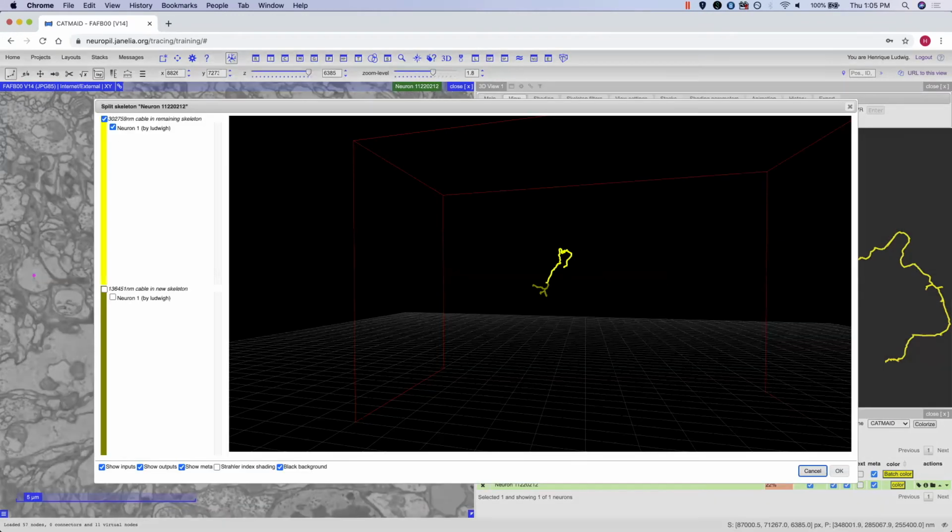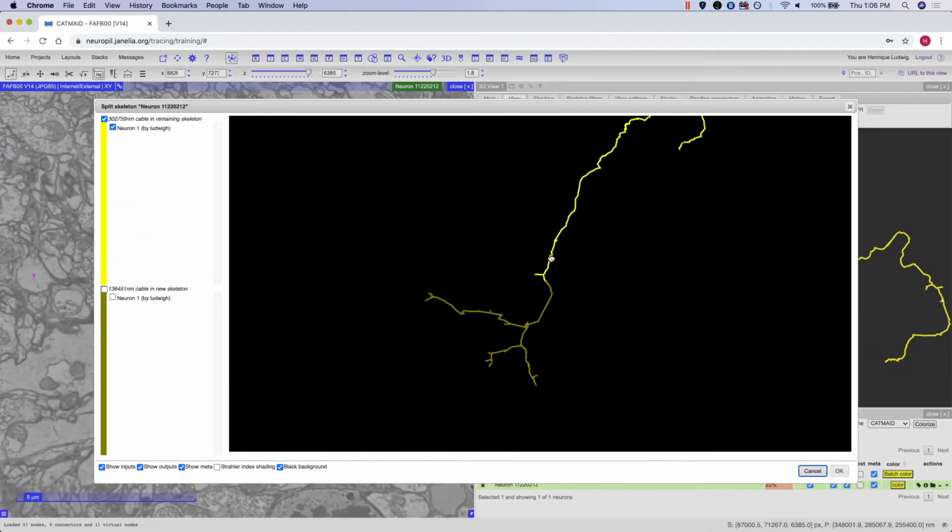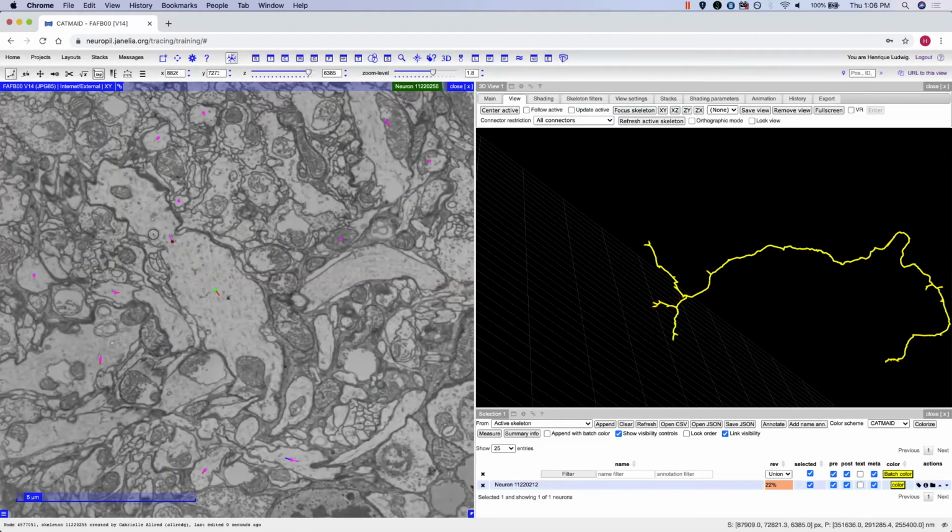This will also bring up that same type of window that you've seen with the merge, indicating that you want to split these two neurons from each other. If this is correct, you can go ahead with it by pressing OK, and both of those neurons will no longer be merged together.